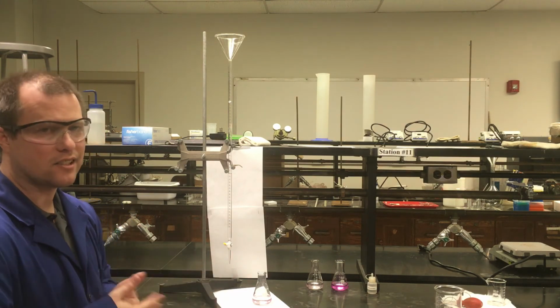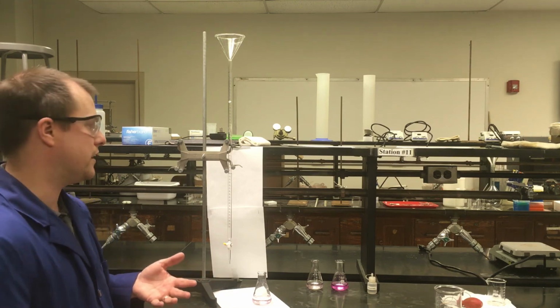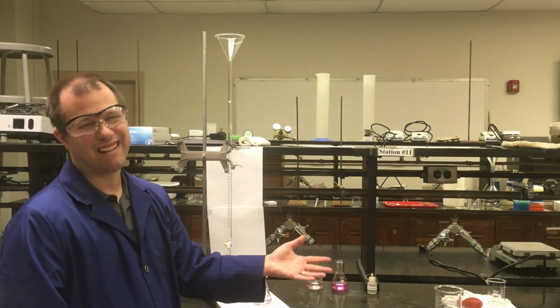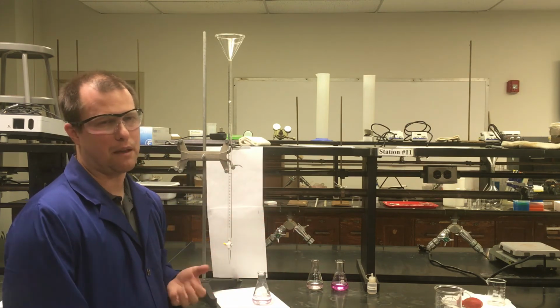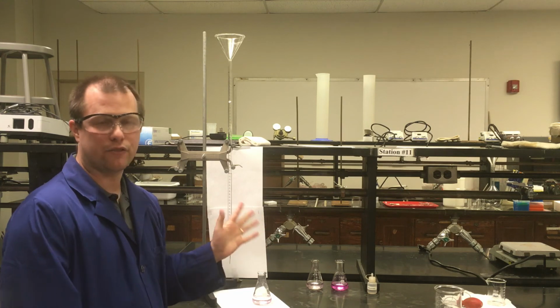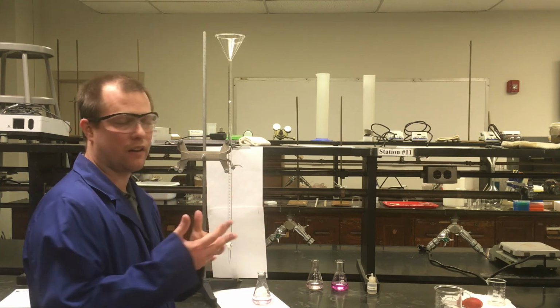Disposal, like waste, things like that. There are some titrations you might be able to put down the sink right away, but if you're doing things like hydrogen tartrate, not necessarily something we immediately want to send down the sink. If you have lots of phenolphthalein, again, same thing, maybe you don't want to put all that down the sink. So a lot of different titrations probably are going to have waste disposal that you do have to pay attention to. So do be aware of that in the future.